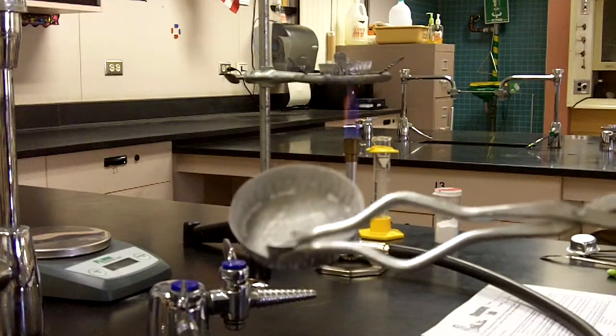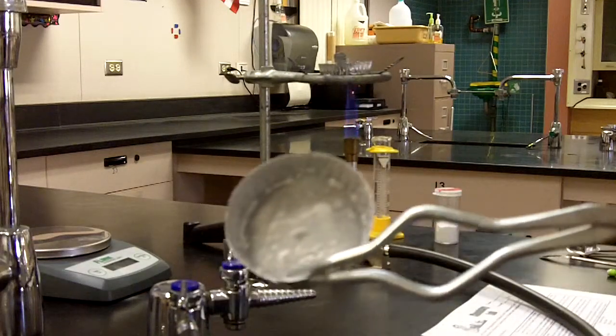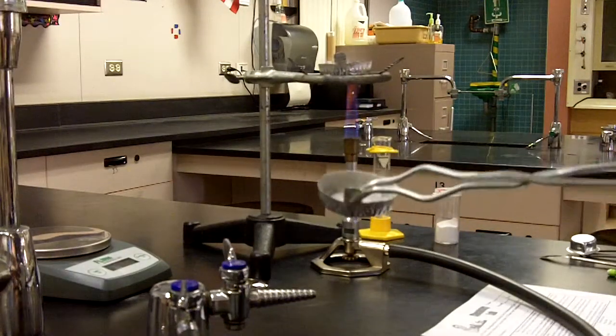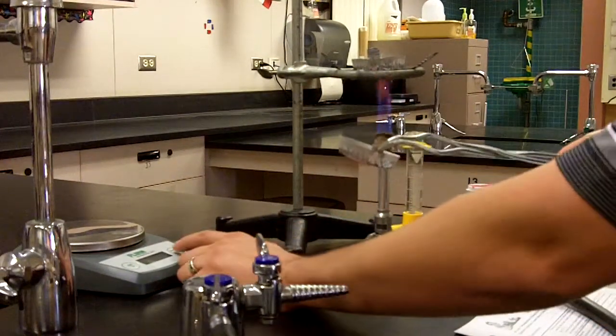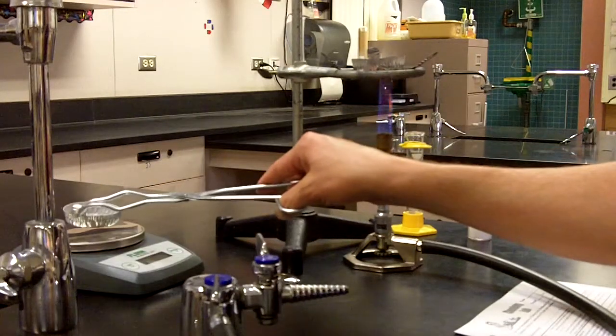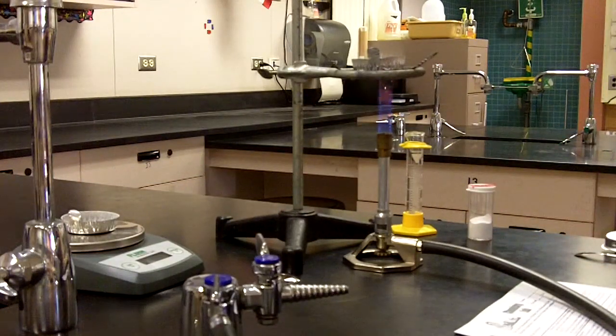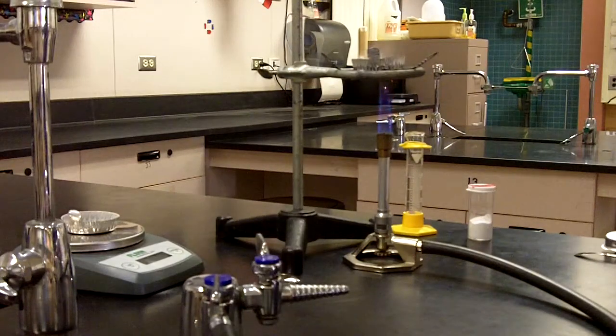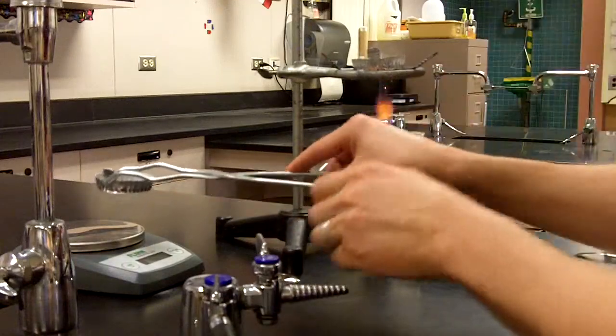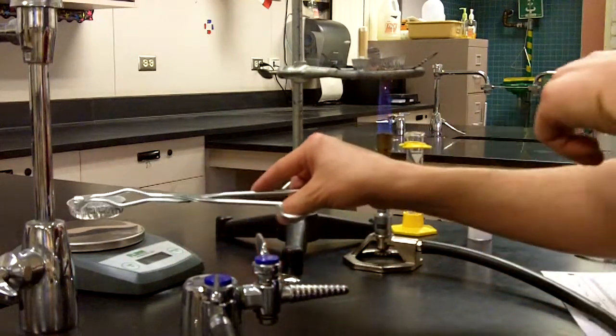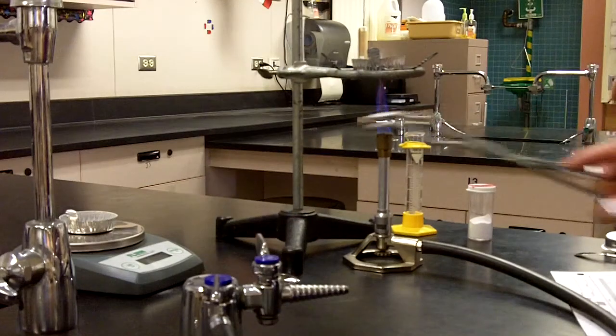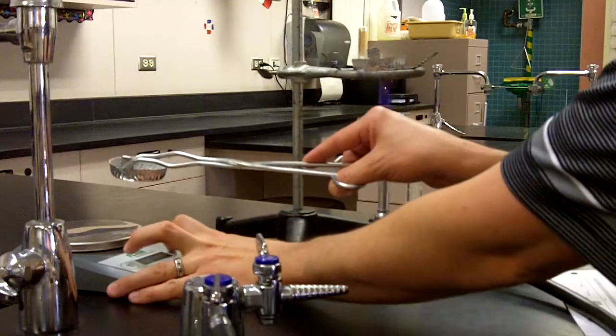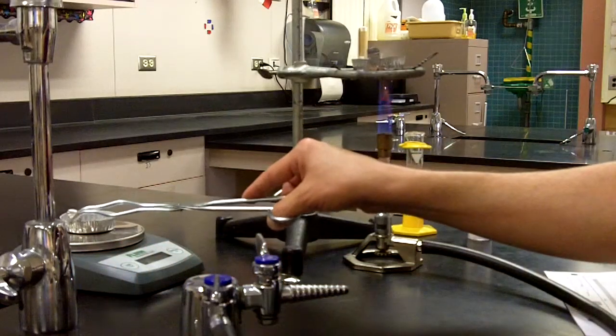We have to adjust our numbers there, but we're going to see what our difference is going to be and write those next to the data table that we got, finding very close similarity within each of these. What I'm going to do is put this on the electronic balance and see what we get. I'm going to re-zero that. This has been cooled, done just previous to this particular lab setup. Re-zero that. There we go, finally cooperating.